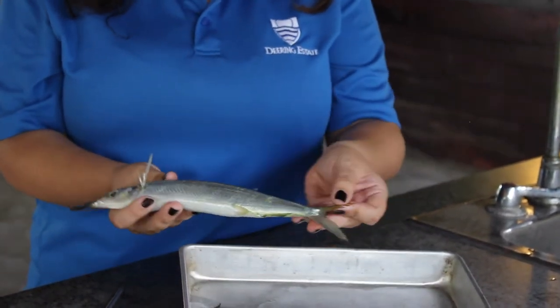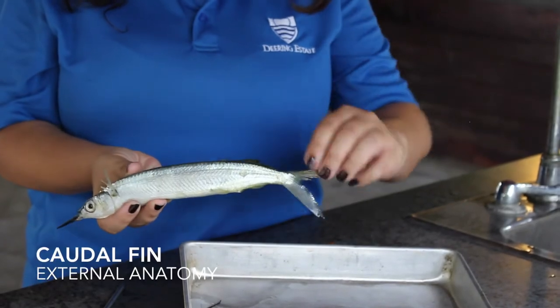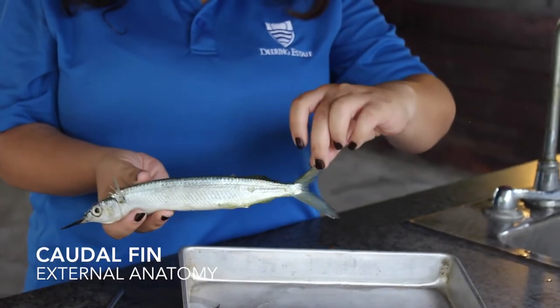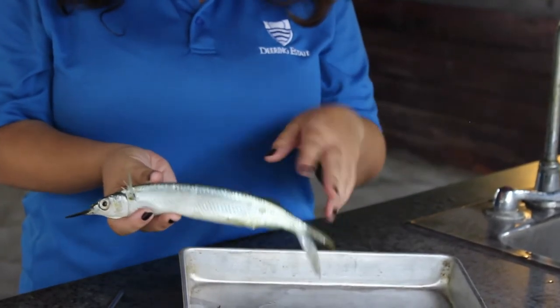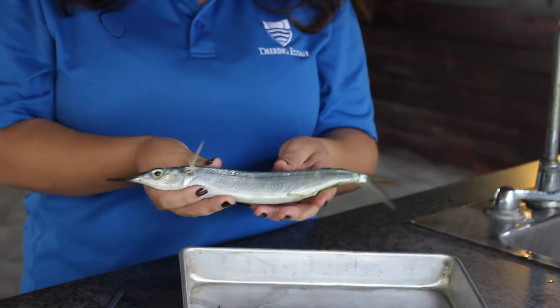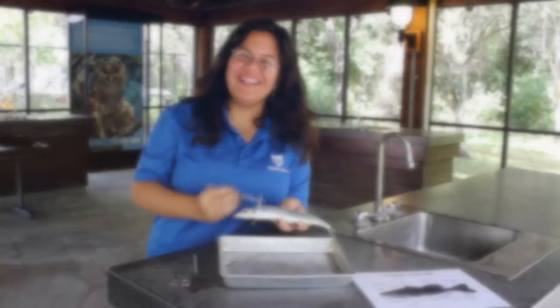You can see here the tail fin, also known as the caudal fin, has a deep V. In fish, that usually means it has to be very fast. And as a bait fish, that means it's always being chased by fish.